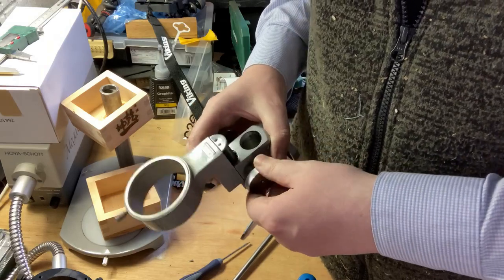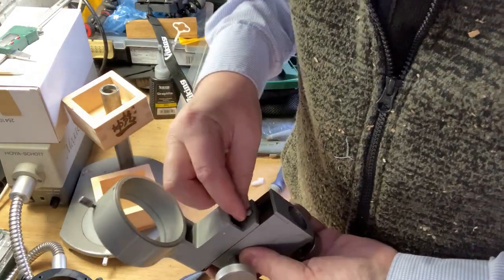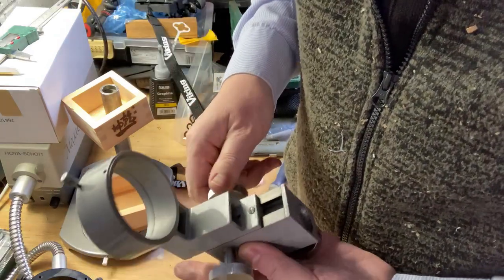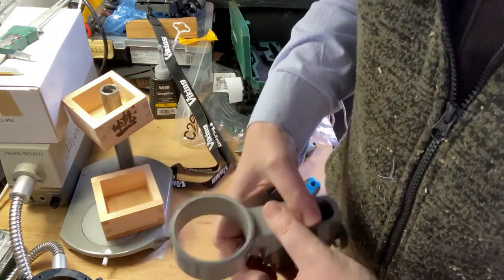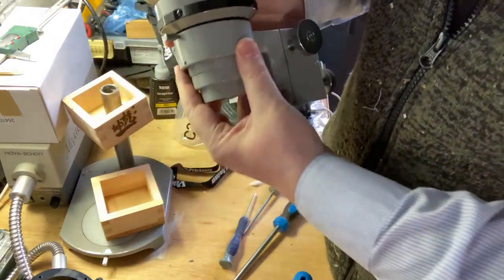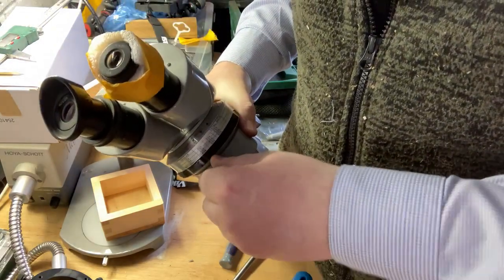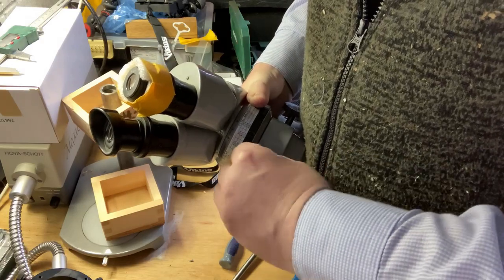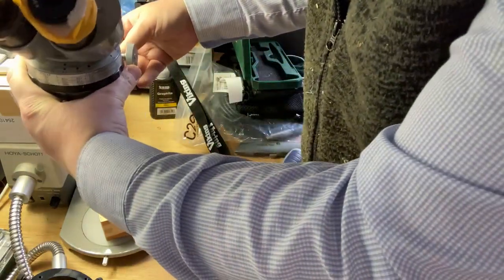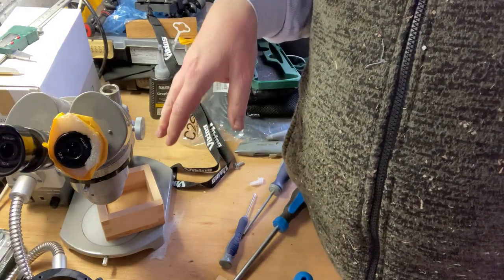So it's going to be straightforward to fix this all back in place. I'm just putting a screw back on. Okay, that's still got the mechanism. Okay, and then I'm just going to pop this back on. And it's this way because it's going to be looking out. That's locked, and then this back on here. And that's the breakdown of it.